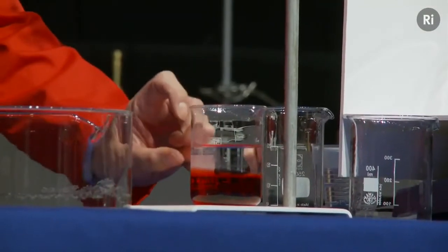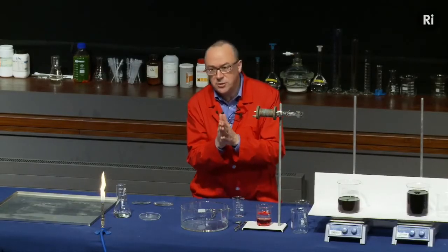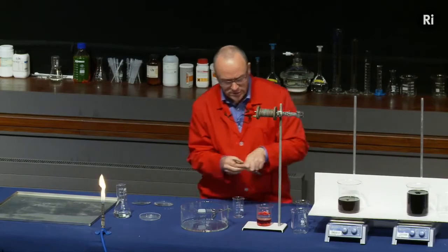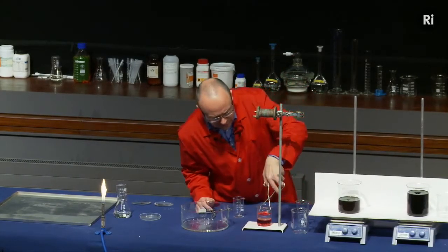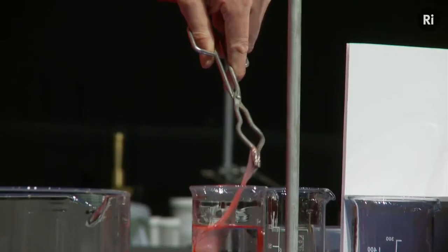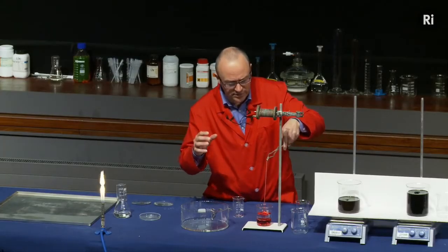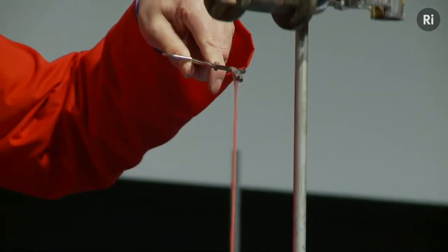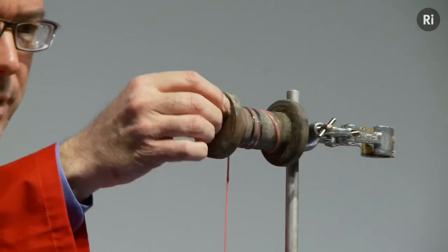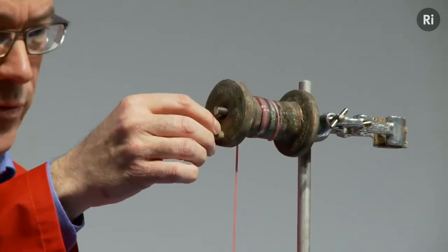So what I've got now is one liquid floating on top of another, and where they meet, they undergo a chemical reaction. They're actually making a solid. A solid material is formed where the two liquids meet. And what I can do is fetch out some of this solid material. As I pull it out of the beaker, it allows the two liquids to meet each other again, and so they react again to form more of this solid. So as I wind, I'm pulling up this material and it allows the two liquids to meet again and it forms more of this material.